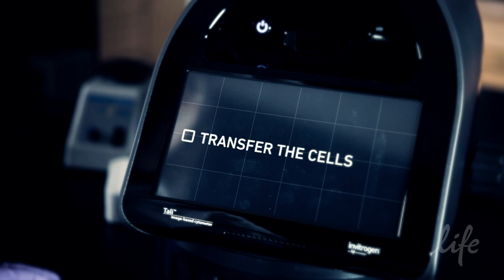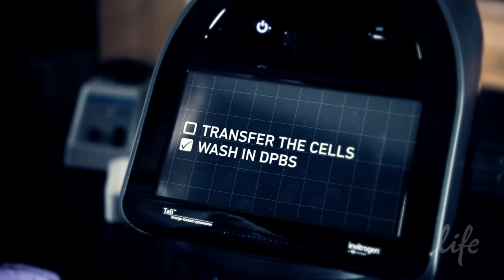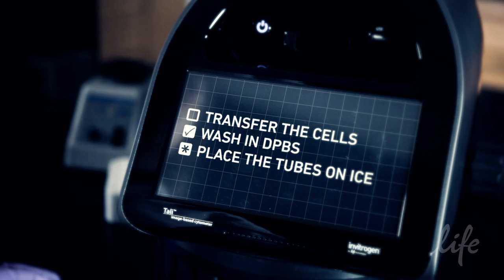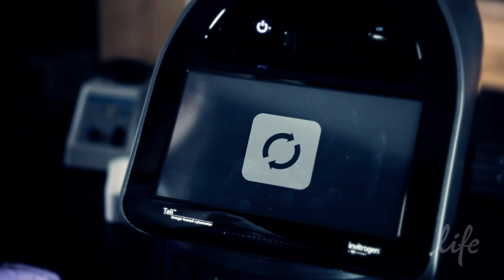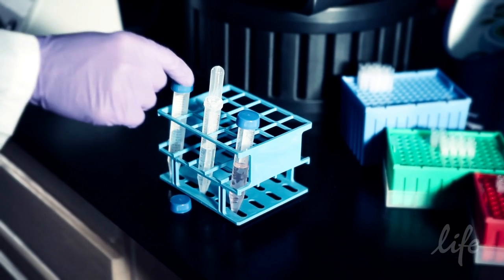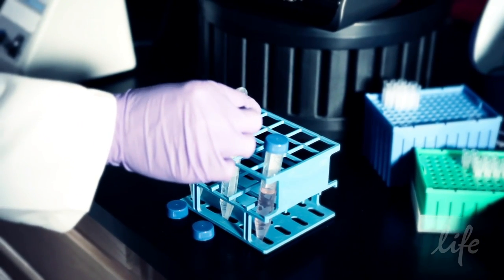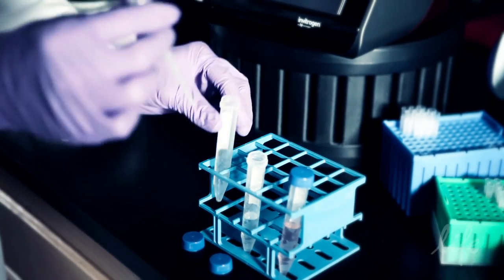Transfer the cells into conical tubes and wash them in DPBS. Place the tubes on ice. Remove the DPBS and slowly resuspend cells in ice-cold 70% ethanol to 1 million to 5 million cells per milliliter.